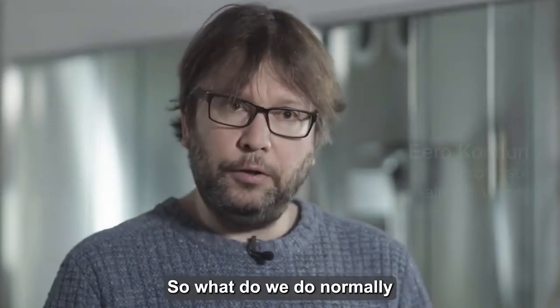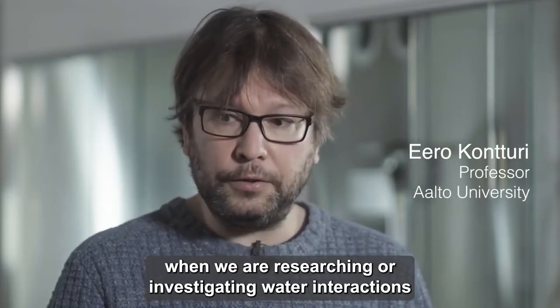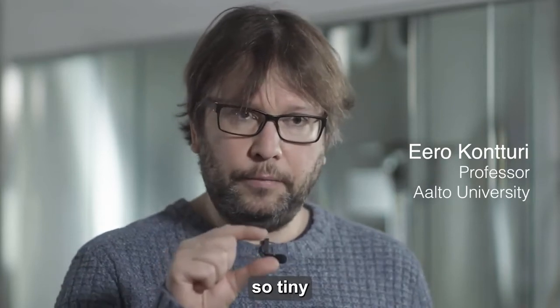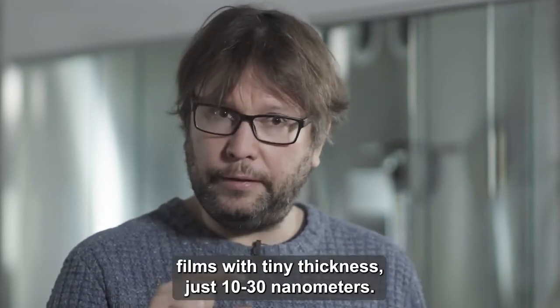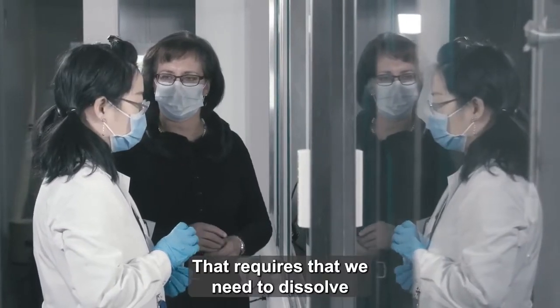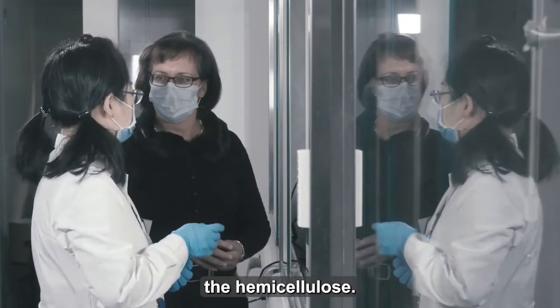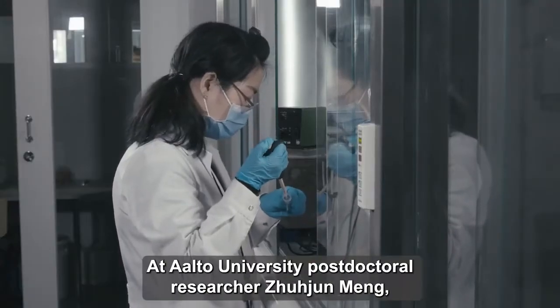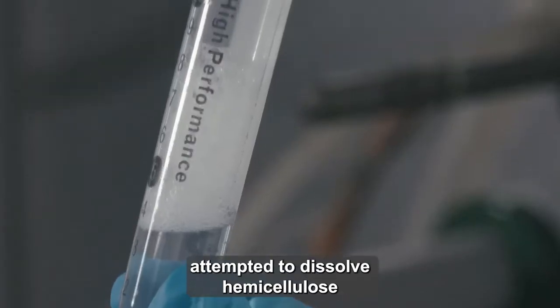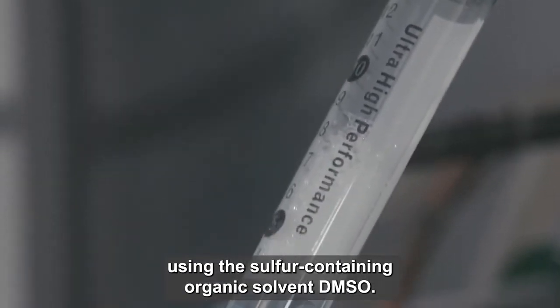So what we do normally when we are researching or investigating water interactions, one of the routes that we take is that we make model films, so tiny films with tiny thickness, just 10, 20, 30 nanometers. And that requires that we need to dissolve the hemicellulose. At Aalto University, postdoctoral researcher Zhuzhong Meng attempted to dissolve hemicellulose using the sulfur-containing organic solvent DMSO.